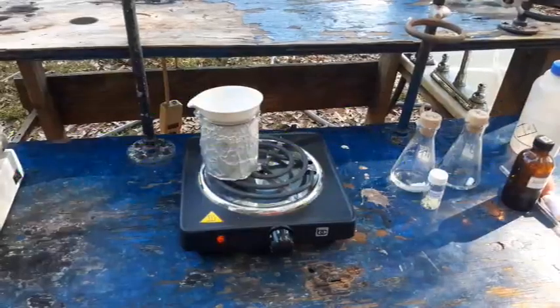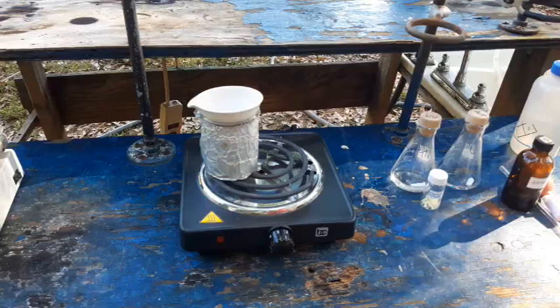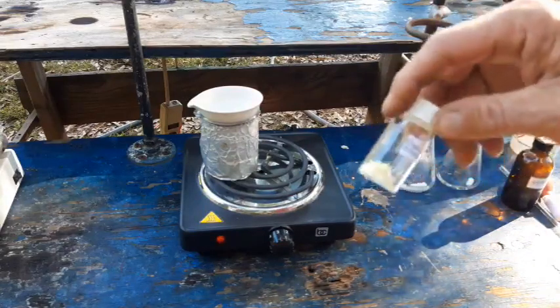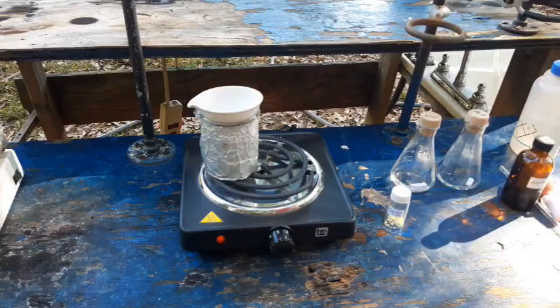So I've got this over some boiling water. I'm going to add a little water and a little bit of nitric acid. The goal is not to go overboard with the nitric acid — that's why I'm doing it this way. It should dissolve very readily. I'll add the acid dropwise. I'm going to go ahead and dissolve the thorium nitrate in some water and get a solution of that ready, then get our uranyl nitrate solution ready and come back when they're ready to go and we will do the preps.